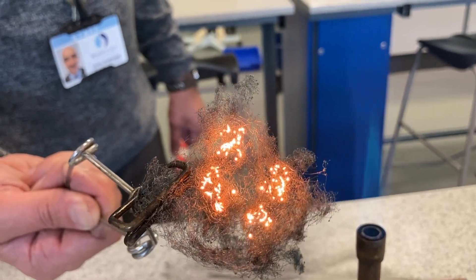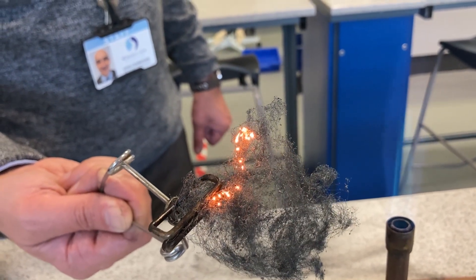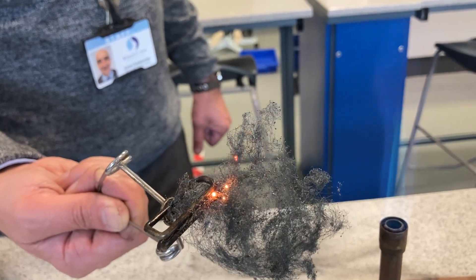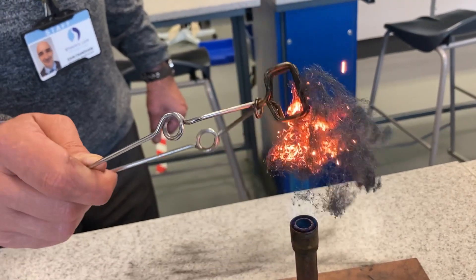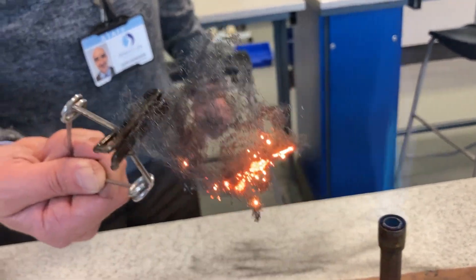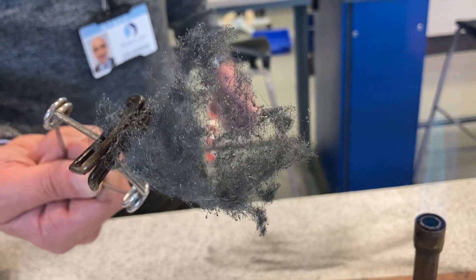And I'll just keep going until all the iron is gone. Don't have to heat it. Let's see if there's any little bits I've missed. Now most of that's just glowing with heat — I take it away, those little bits that are still going, that's reactions, they're releasing heat energy.